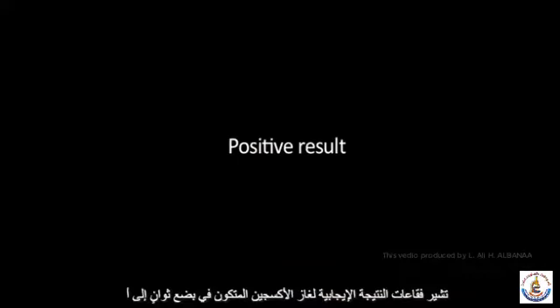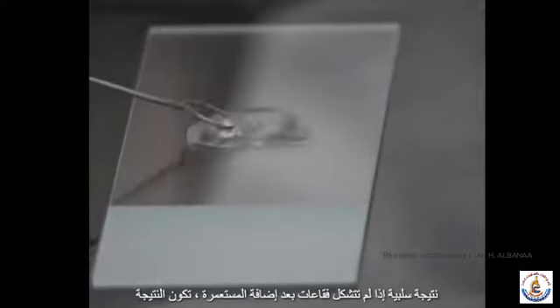Positive result. Bubbles of oxygen gas forming in a few seconds indicate a positive result. Negative result. If no bubbles form after the colony has been added, the result is negative. Here we compare positive with negative. Oxygen bubbles are clearly visible on the slide to the left.